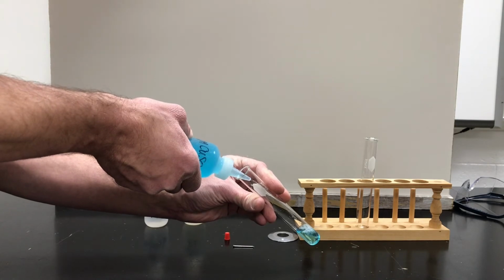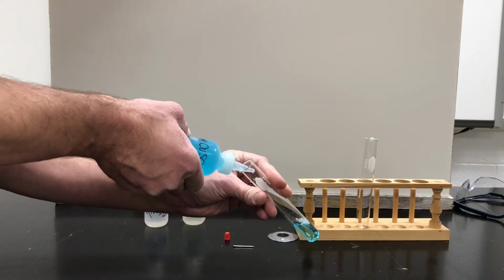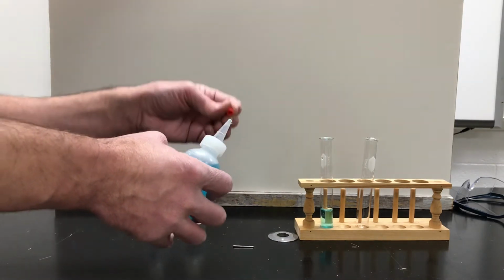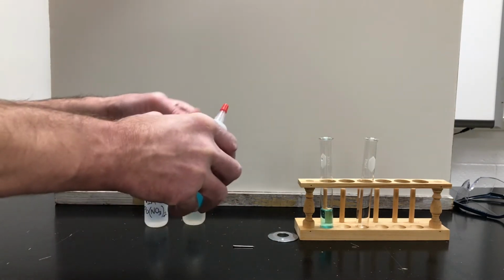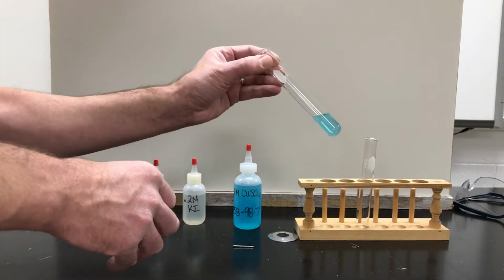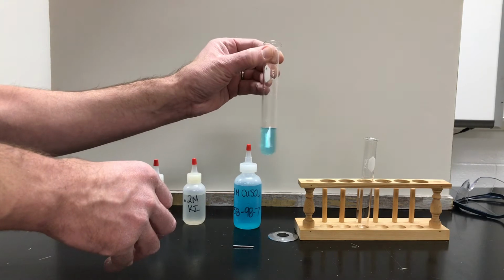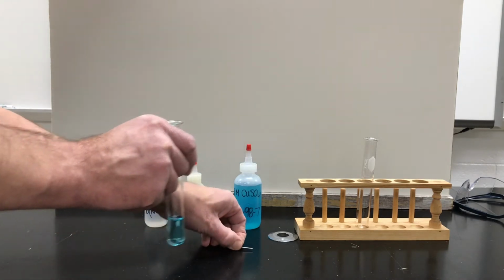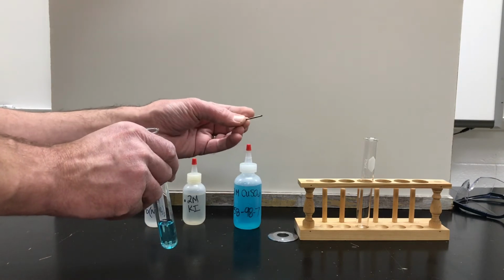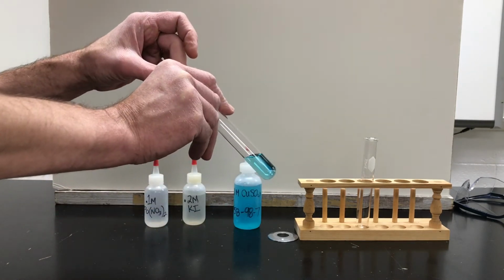in water. And they call that an aqueous solution, because aqua means water. And so we know that the solution is a clear blue solution. We know that the nail is solid and silver gray and shiny. And we'll put that in gently.